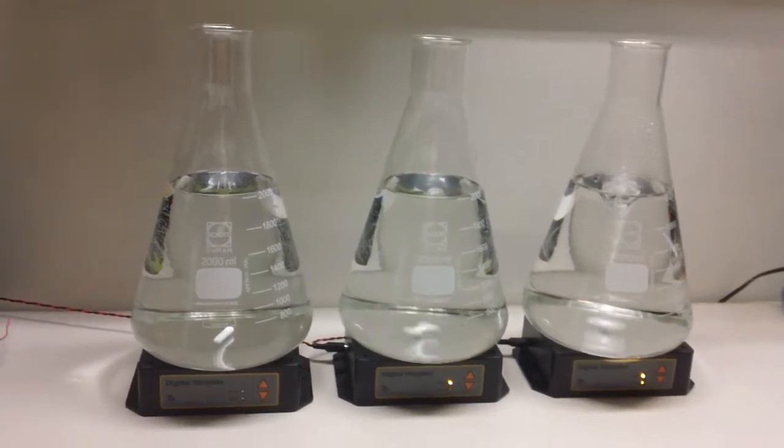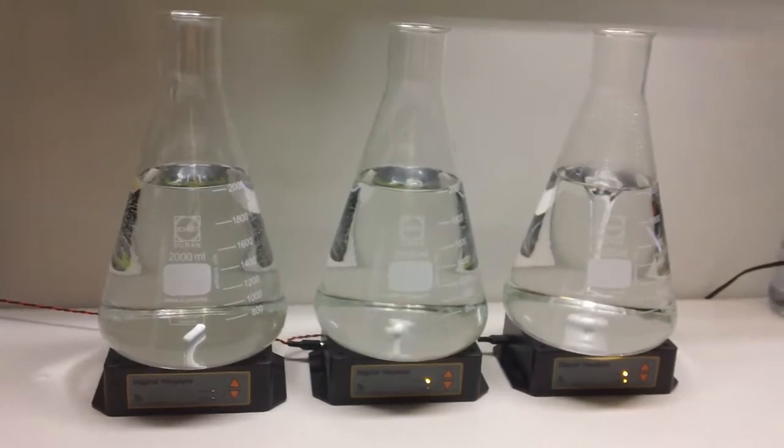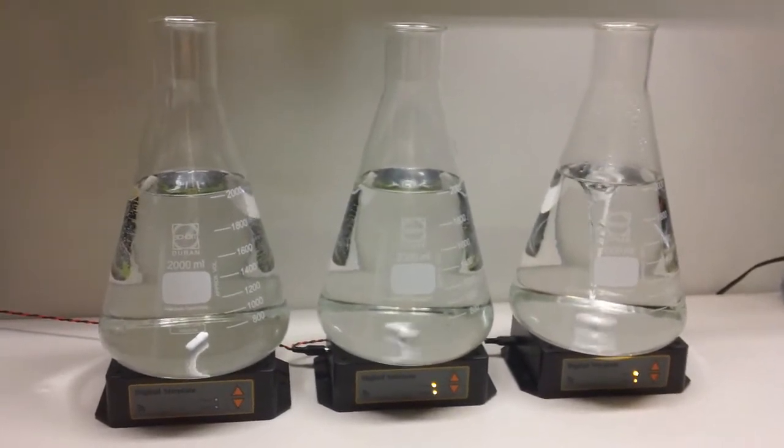Hi, it's Michael here from digitalhomebrew.com and I just wanted to share with you the results of a test I've been running since last night to determine the heating effect that a stir plate has on your starters.